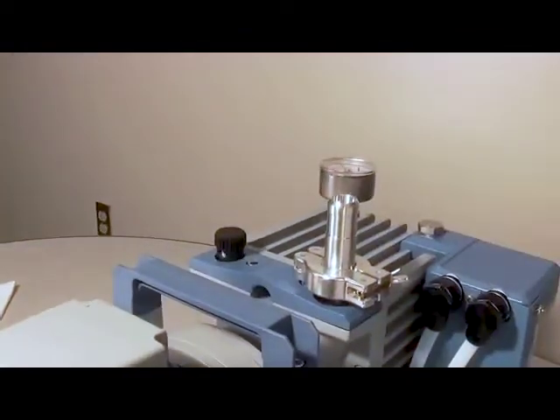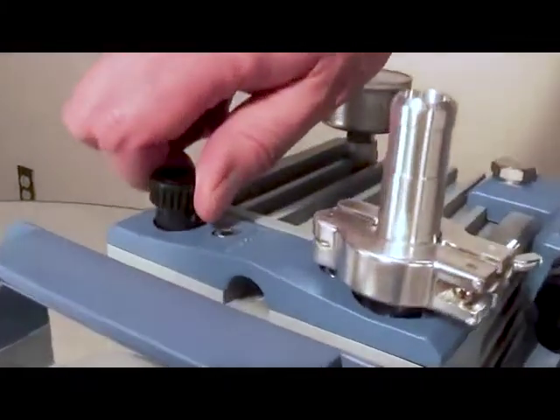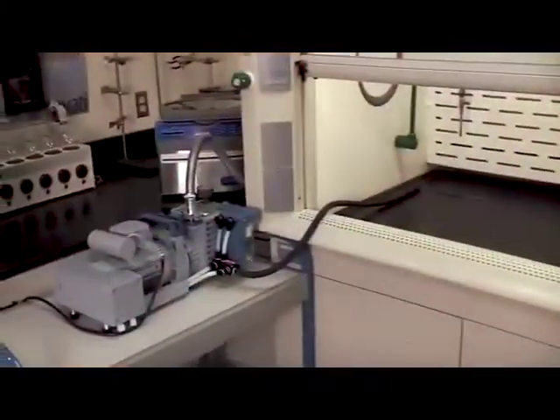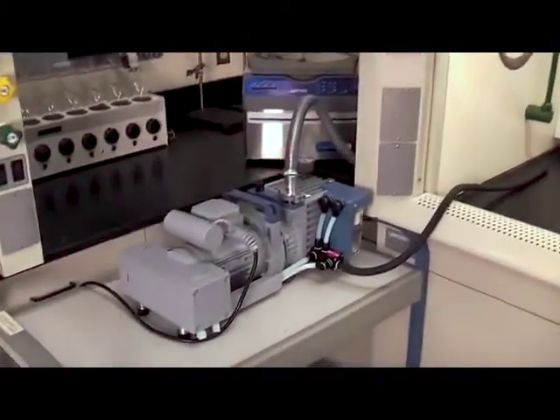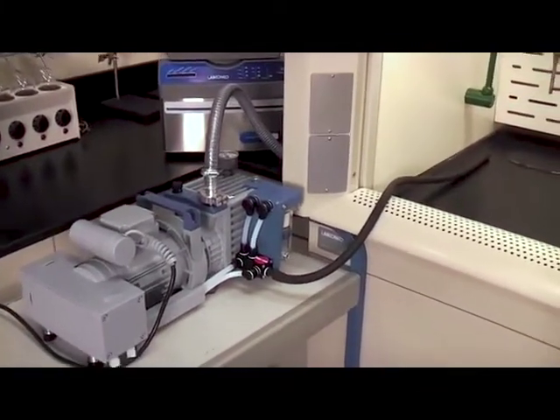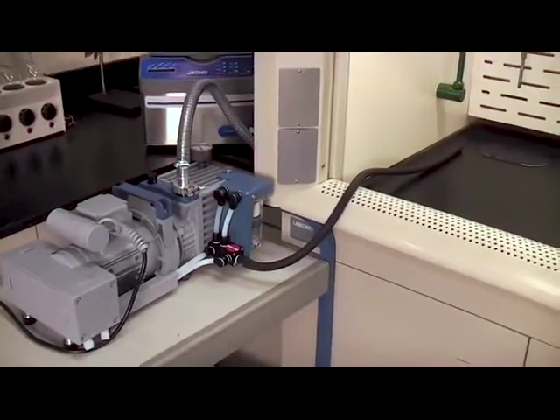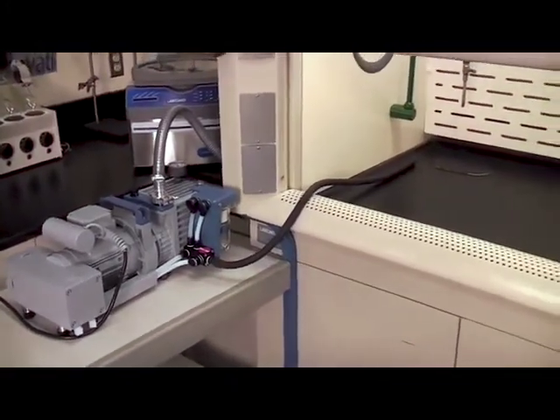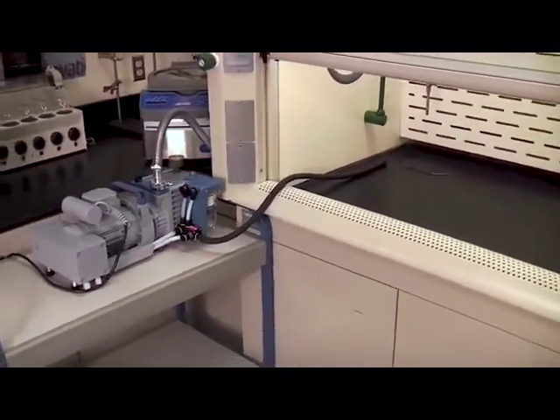Running the pump with the gas ballast closed will allow for a deep vacuum. It's recommended to vent the pump into a chemical fume hood to prevent vapors from escaping into the lab. To do this, attach a hose to the exhaust of the pump and run the hose into a fume hood.